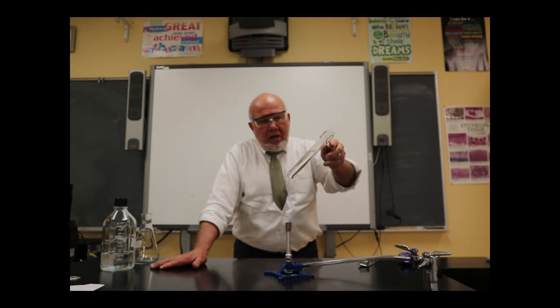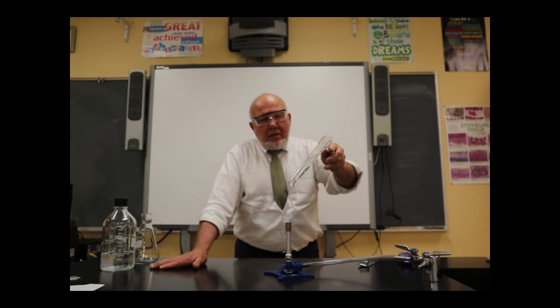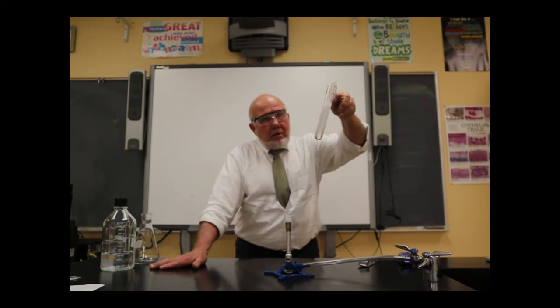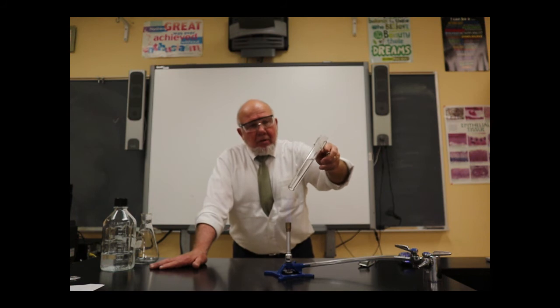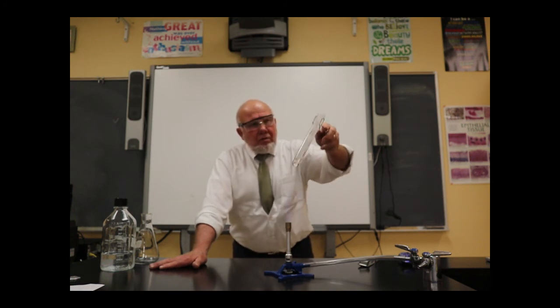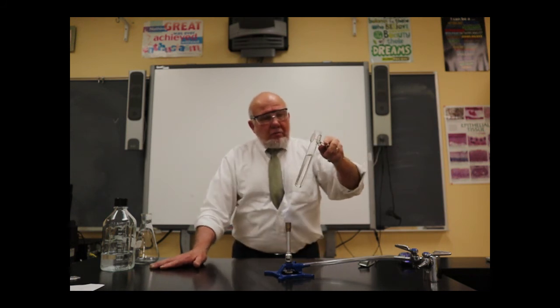evaporate out. See that? So when it starts doing that, I've got to kind of just keep it going. All right, you can see steam coming up, but that's what we're talking about. We're near the boiling point right now. So part of why I wanted to do this, it's tricky, is to show you how to do it.